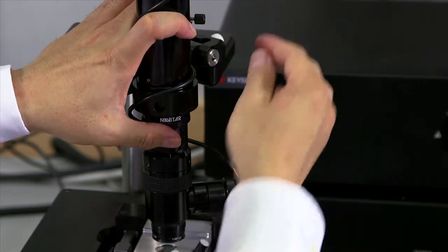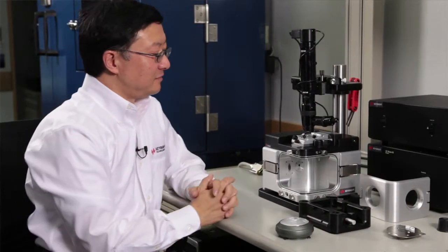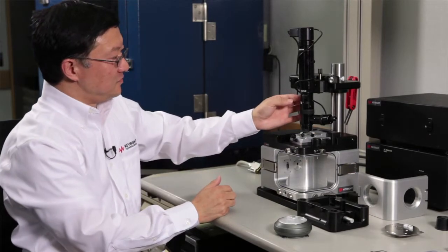Now, in order to properly align and focus, you need to have the focus ring, the zoom ring, to have its all the way zoom out position. Here is the zoom ring.